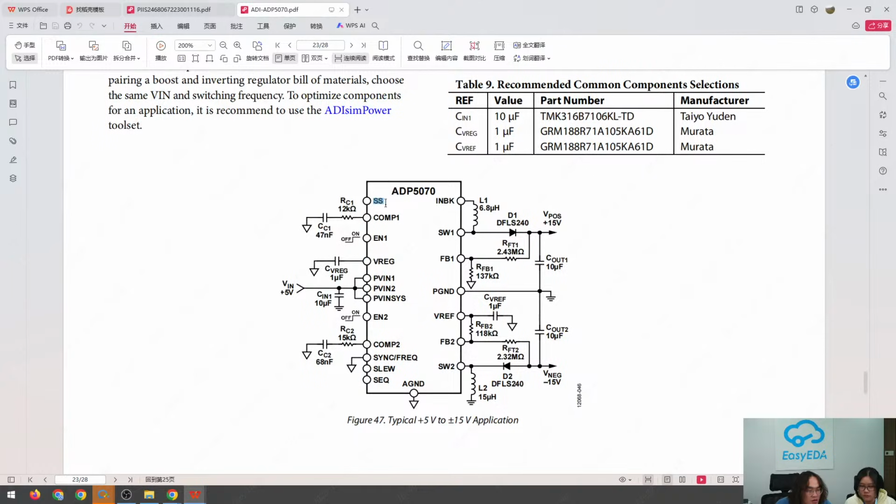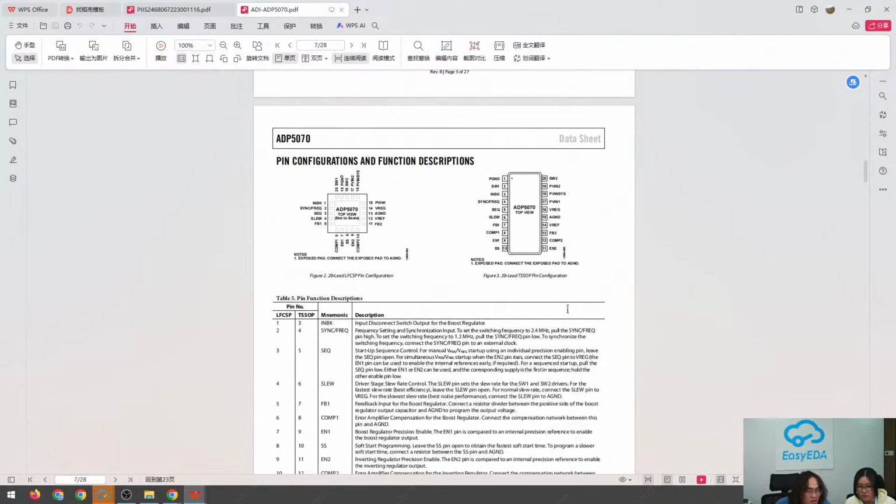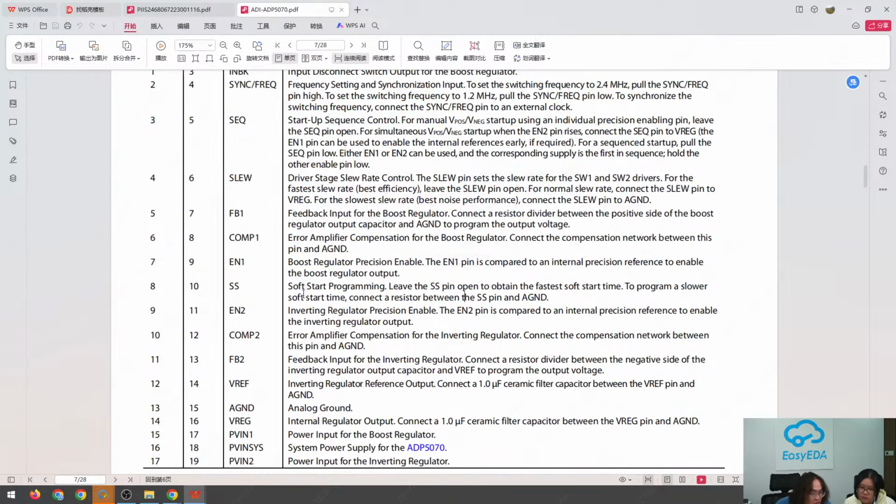If you are not sure what the functionality of the SS pin is, we can go back to the pin function descriptions. It's a soft start programming pin, and you can leave this pin open for fast start. Okay, we can leave it open. Also, this is the boost regulator precision enable, compared to an internal precision reference to enable. So we are going to not connect it.